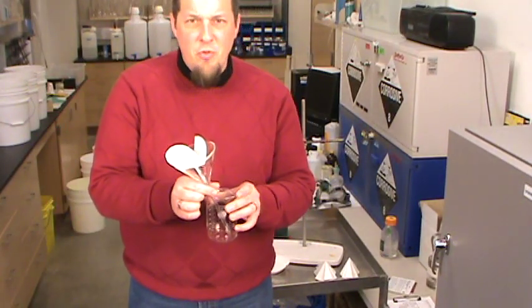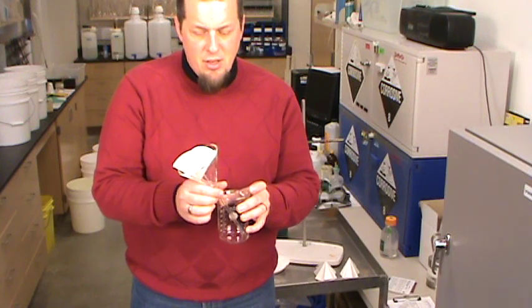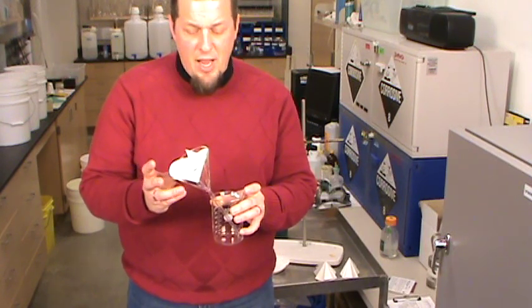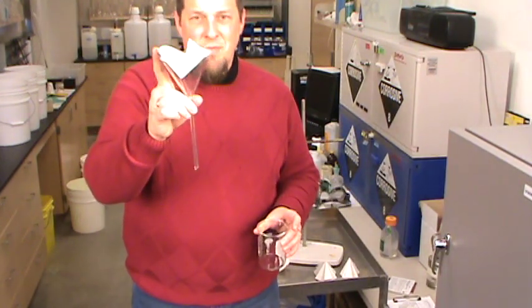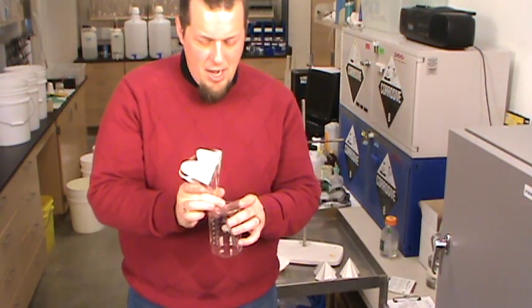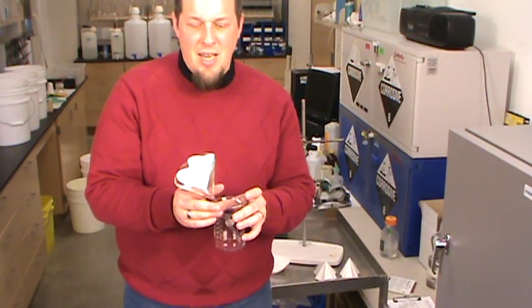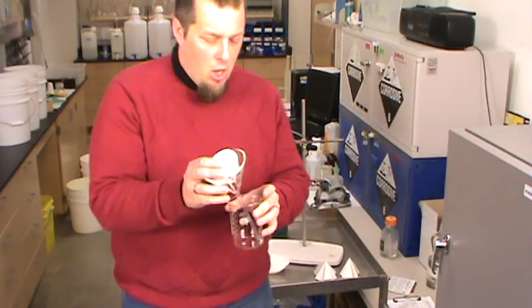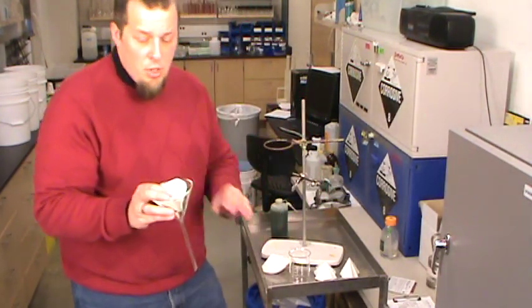I've seen a number of people try to very carefully balance these filters in a beaker or an Erlenmeyer flask, but because of their shape these funnels are extremely top heavy, so the chances that you're going to be able to balance this and not have the whole thing tip over and dump your experiment are pretty small.